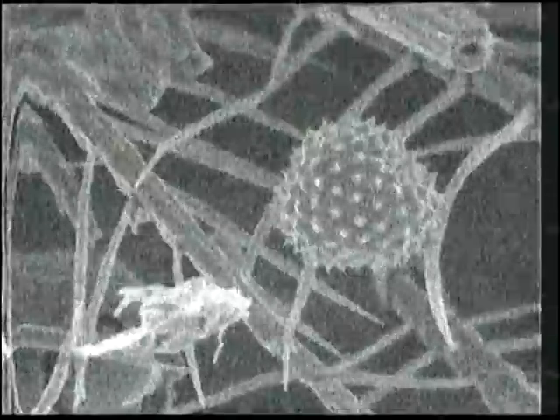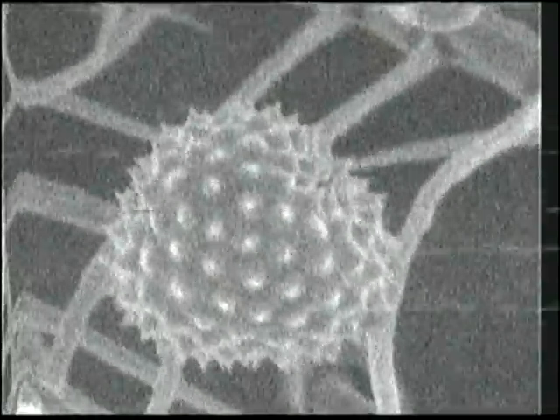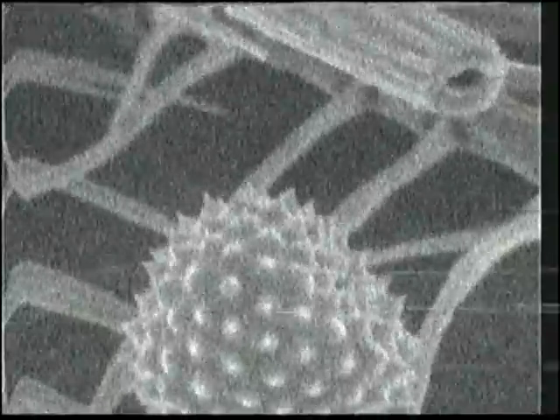We can look down the end of a hair. We see that it is hollow, and it has a hollow tube that is only a few microns across. I would guess possibly 3 or 4 microns across. We can use the pollen grain as a gauge. I don't know how big the pollen grain is. I'll find out later, but I don't remember exactly how big it is. But you can see the tube, and so those are definitely nanostructures, I think, that are built by nature.